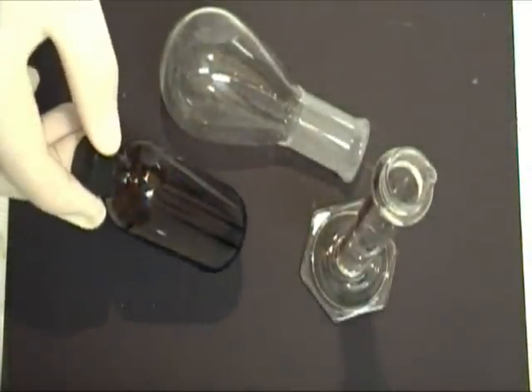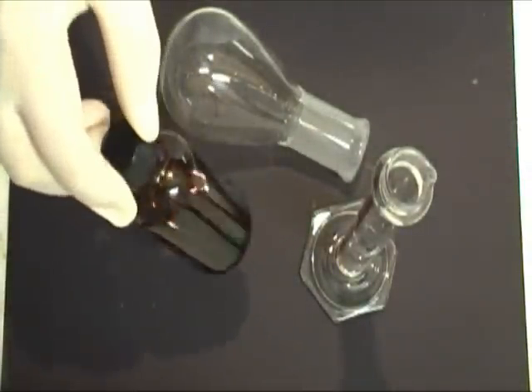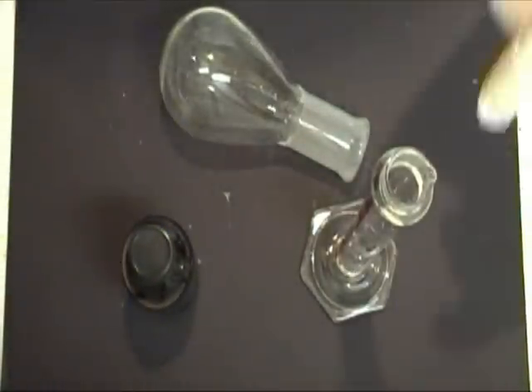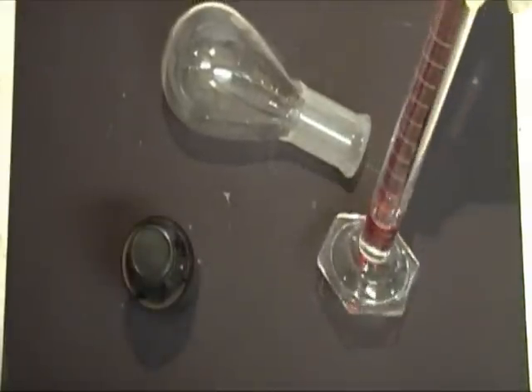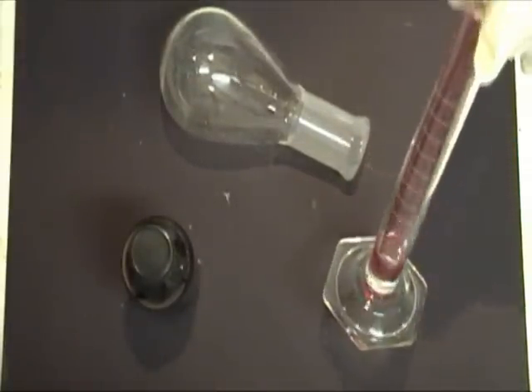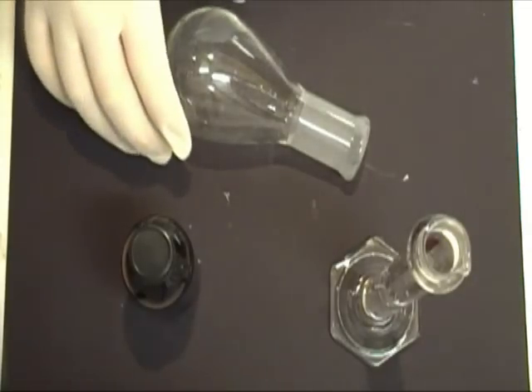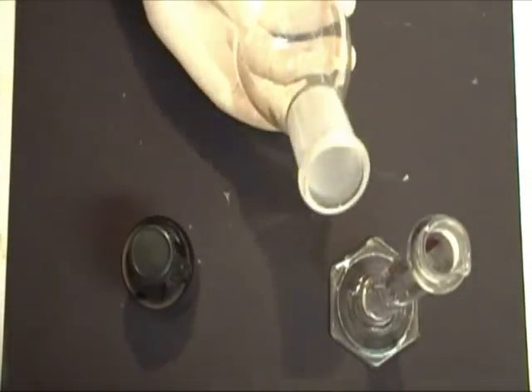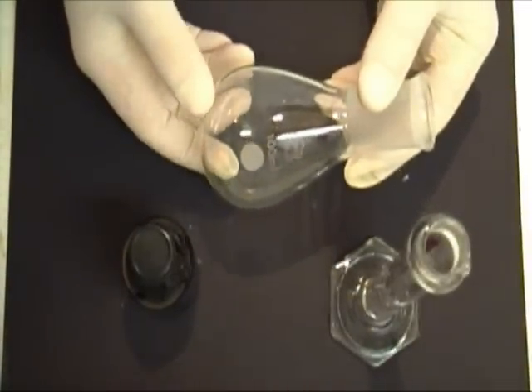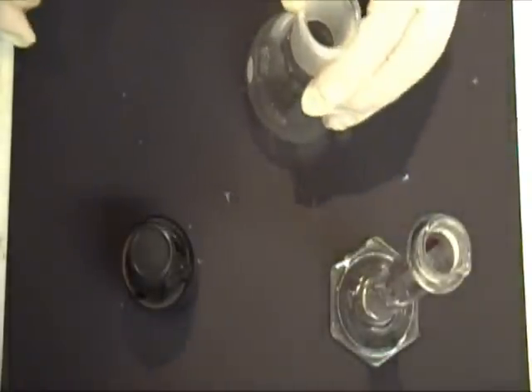To begin, you're going to need some cyclohexanol — I have about 70 milliliters here. Next, you're going to need some phosphoric acid; I'm using about 5 milliliters. You're also going to need a boiling flask to run this reaction in. I'm using this pear-shaped type.